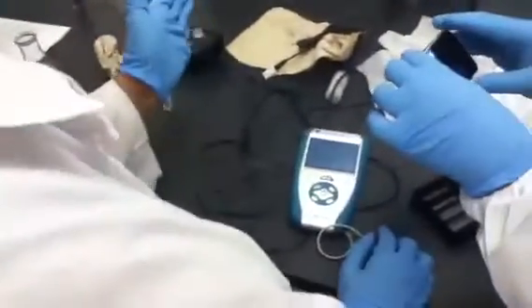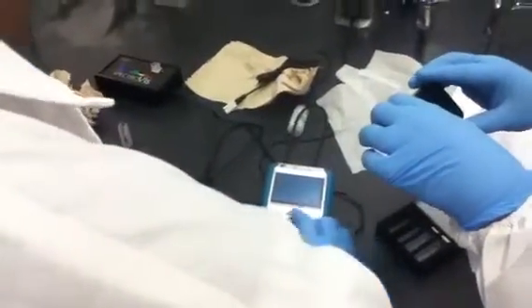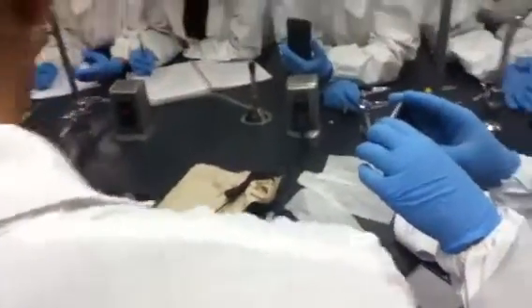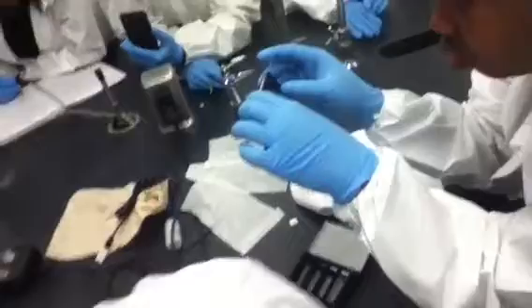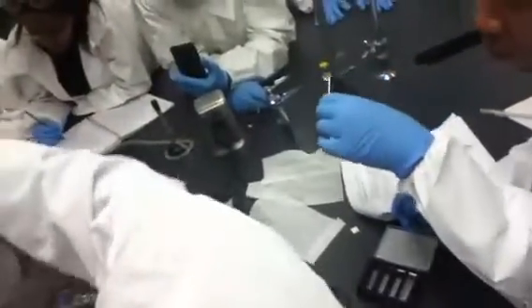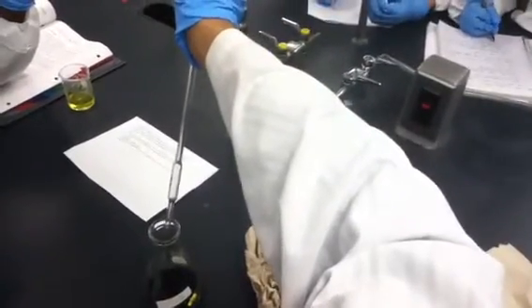So what this will be doing is taking the spectra for the toluene that I put in. Now I need a solution. Our blank would be water. I put the toluene first in this case. Very carefully from the top. Make sure. Where are we going to put it, Professor? Just from the top. Remember, we are removing the organic layer in this case.